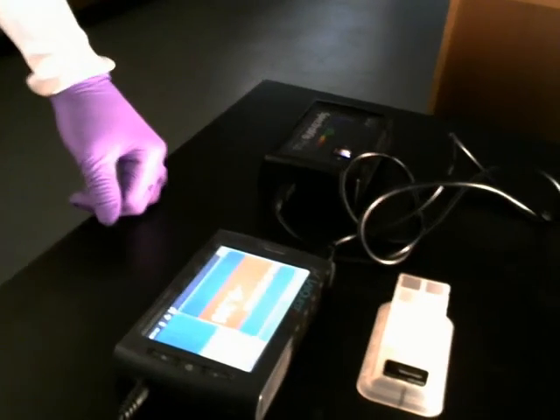And while I wait for the next time point, maybe I can show you what this kind of looks like. It's bright enough, so you can see a little bit. There's the dark control, the no chloroplast, and the 30 centimeter. There's the 60 centimeter. There's the 90 centimeter.